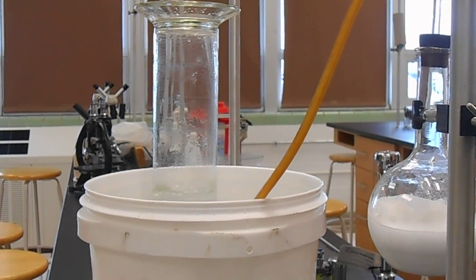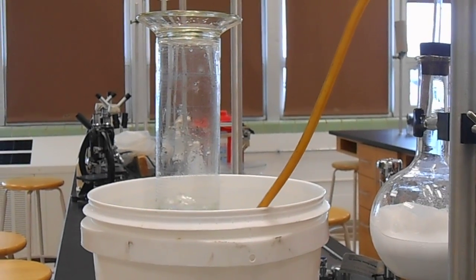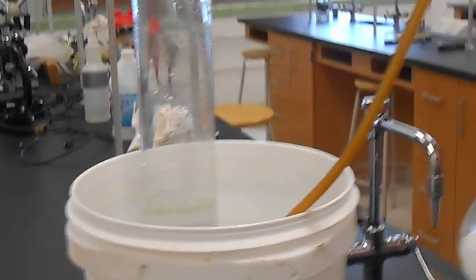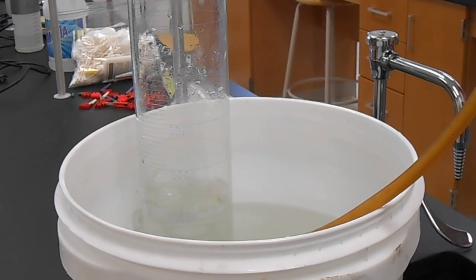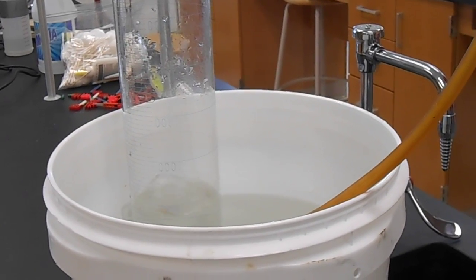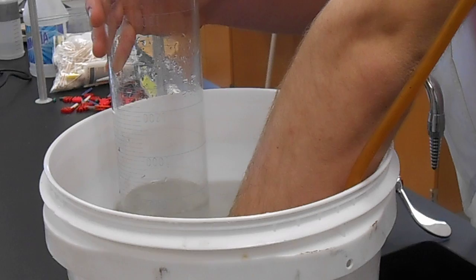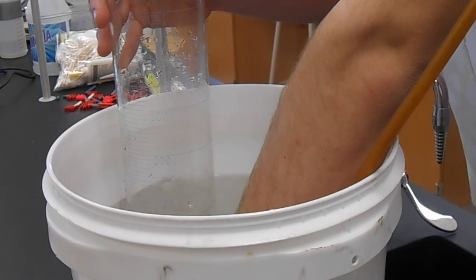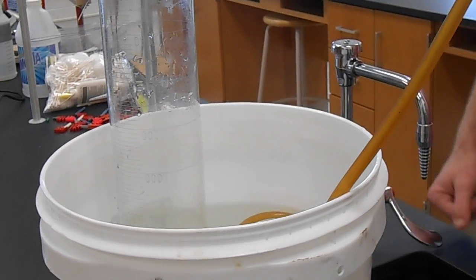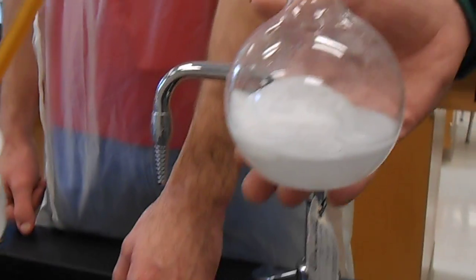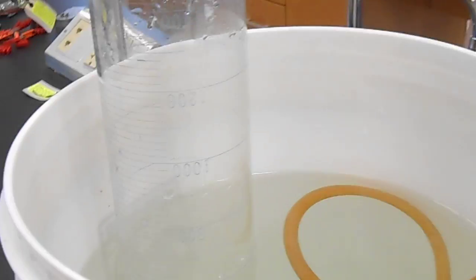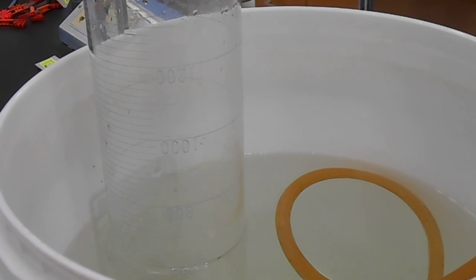This is a 2-liter graduated cylinder, which is measured out. Our goal is to get this completely full with gas. Let's do this. Exciting, isn't it?